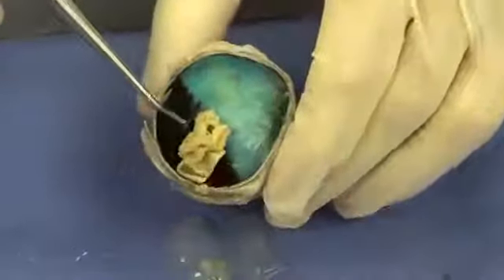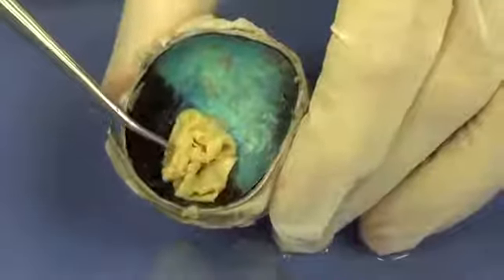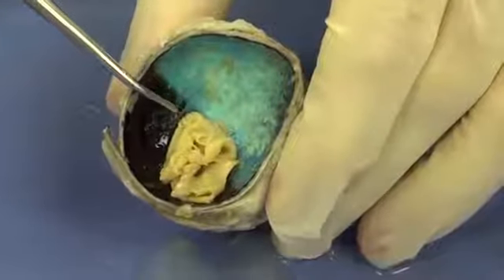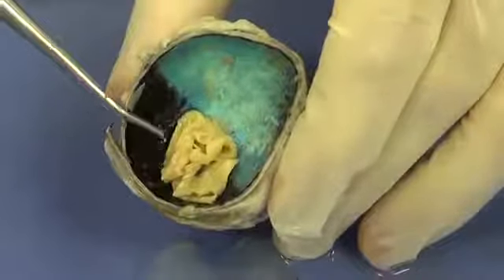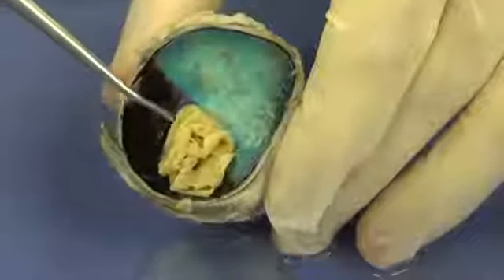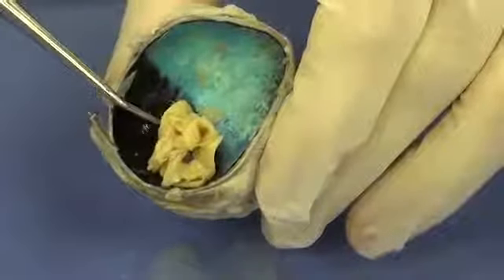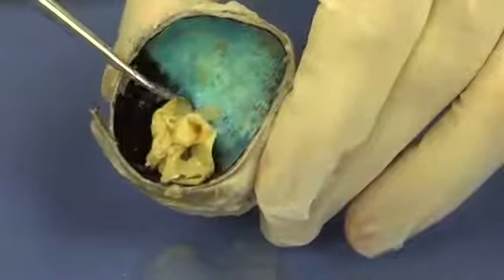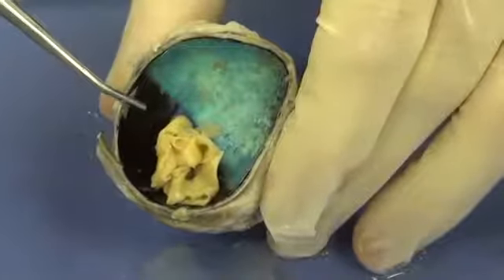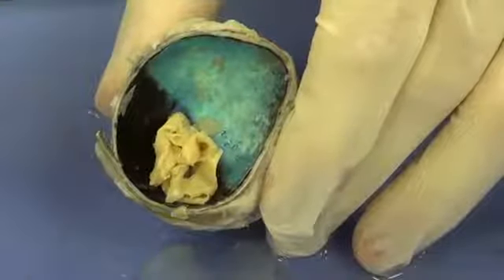And we're looking, there it is. You can see that one place right there where it appears as though the retina is passing through a hole in the eye. What that is, is actually the axons of the nerves in the retina. All the axons of the nerves in the retina are passing through the back of the eye. And the spot in the retina where they pass through is referred to as the optic disc or blind spot, because light cannot actually be detected there.